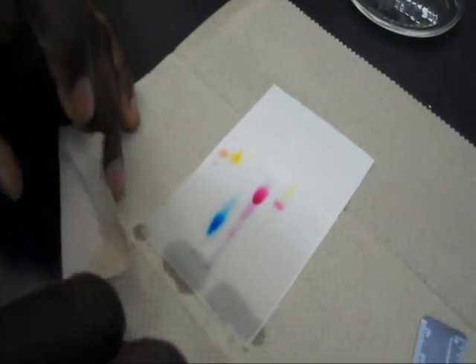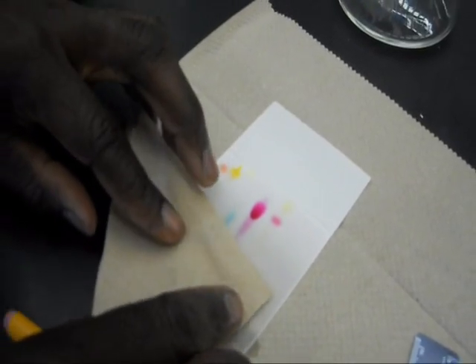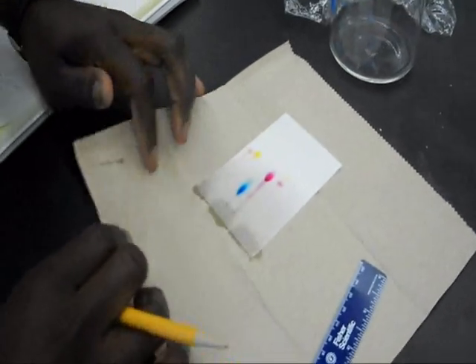The next thing that we're going to do, we're going to draw it off a little bit so you can see how the lines move better.